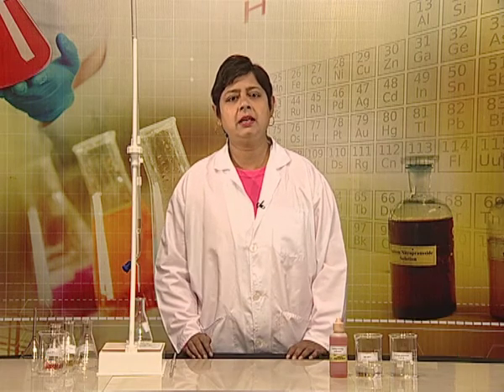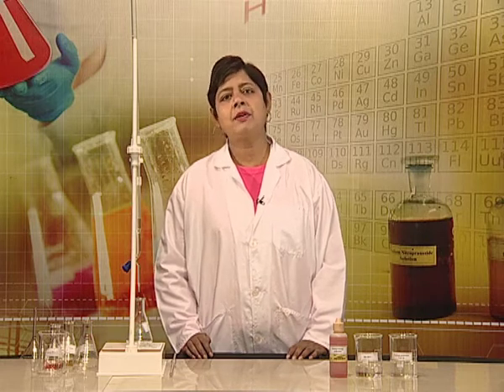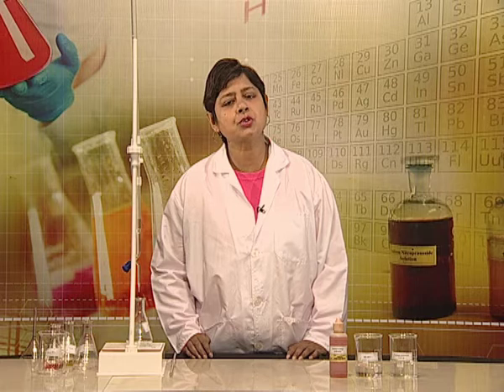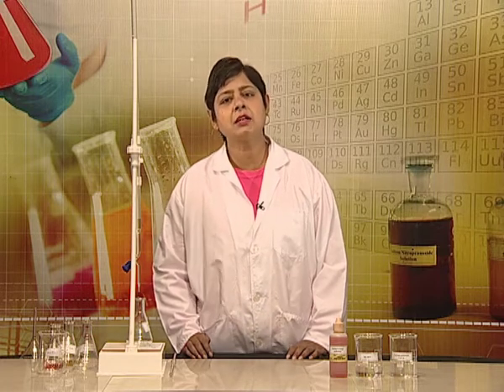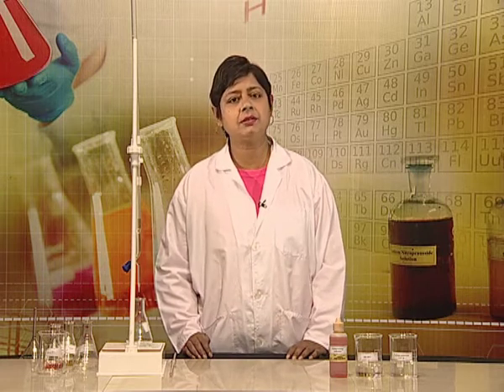In this titration, we will take a known volume of the standard solution of sodium carbonate in a conical flask, and to this we will add 2 drops of the methyl orange indicator. Then we will slowly add the given solution of hydrochloric acid taken in the burette. Addition of methyl orange to the solution of sodium carbonate imparts a yellowish color as the solution is alkaline. However, when we add hydrochloric acid to it from the burette, the pH of the solution decreases gradually. When the pH becomes less than 3.3, the color changes to pinkish red, indicating the end point. It is always advised to keep a reference to compare the color.